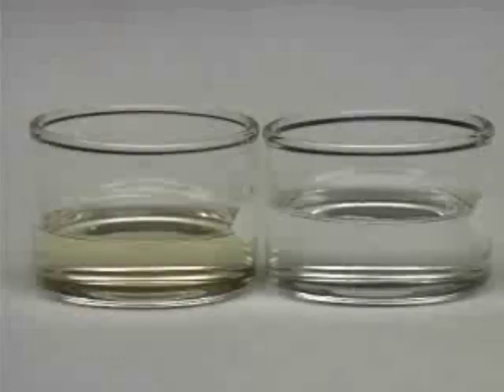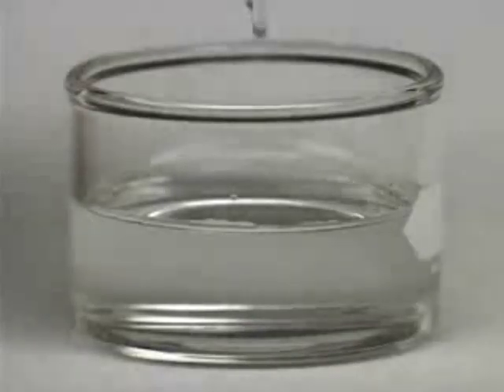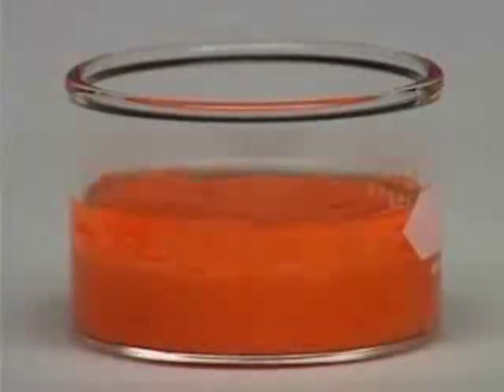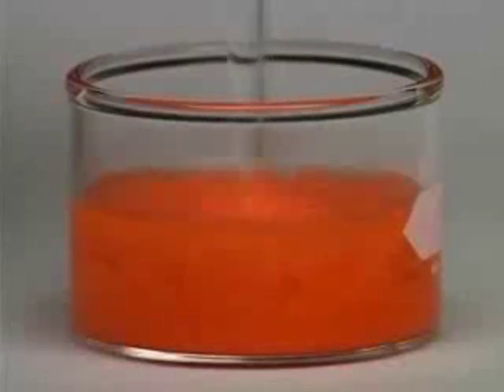Looking around YouTube, I find several great videos showing the reaction of potassium iodide and mercury chloride to form a precipitate of mercury-2-iodide. This is a really popular reaction because it starts with two clear solutions and ends with a bright orange solution.